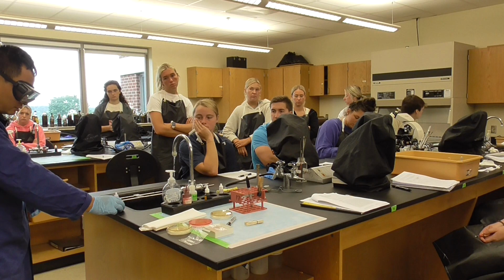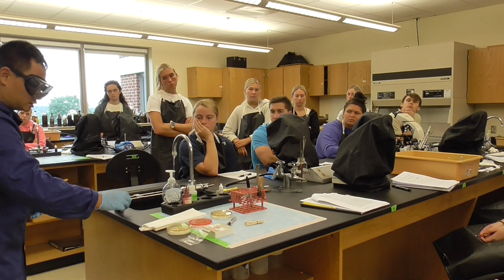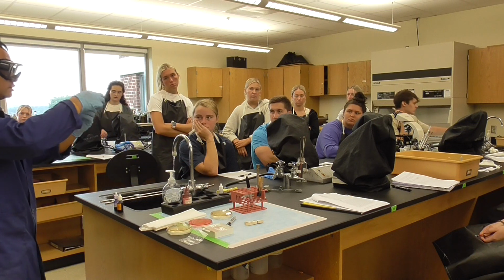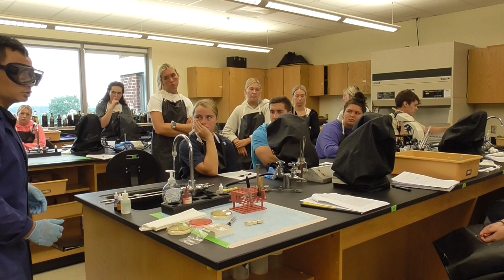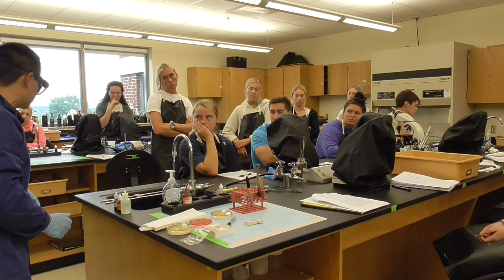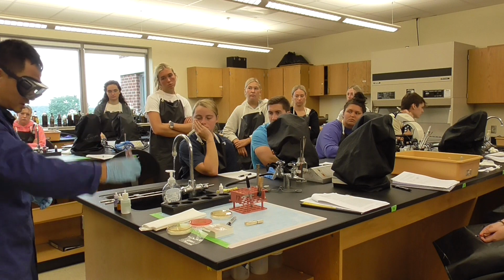Crystal violet, number 1. Number 2 is Gram iodine. Number 3, decolorization, is alcohol. Now, some of you may see the acid alcohol on your bench, don't use it, because acid alcohol is for acid-fast stain. Counter stain, the last one, is safranin.